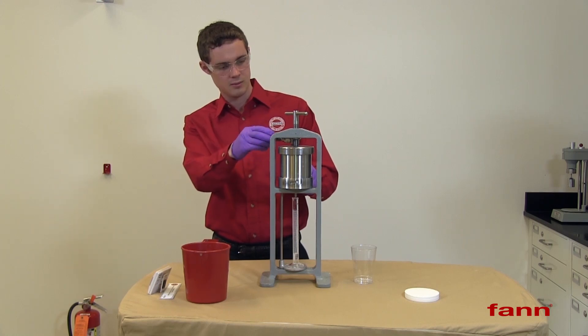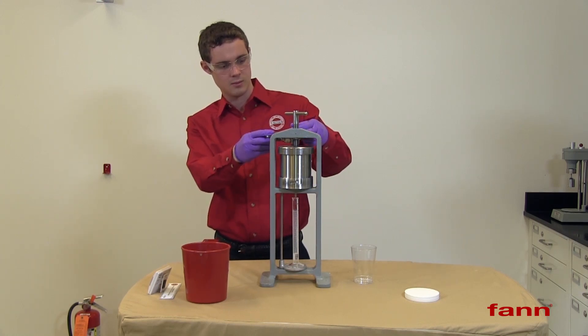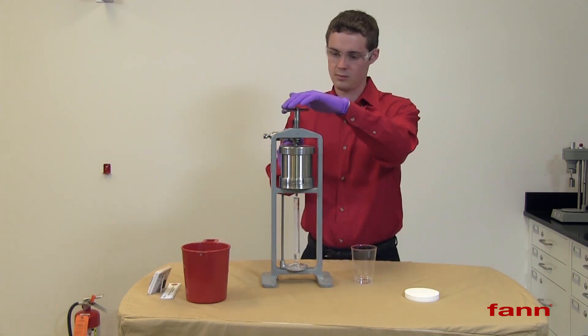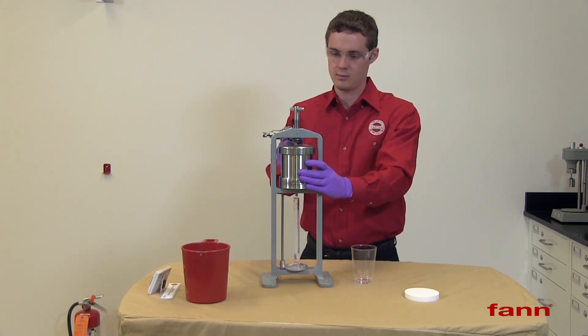We've run the test for 30 minutes. Now turn off the pressure at the regulator and release the pressure from the cell. Remove the top assembly.